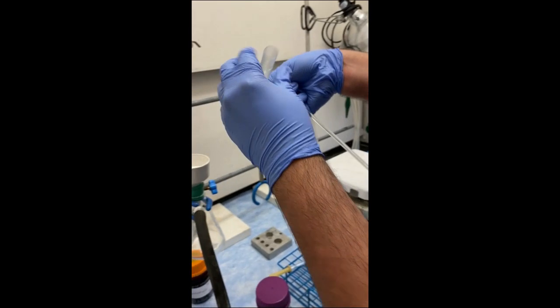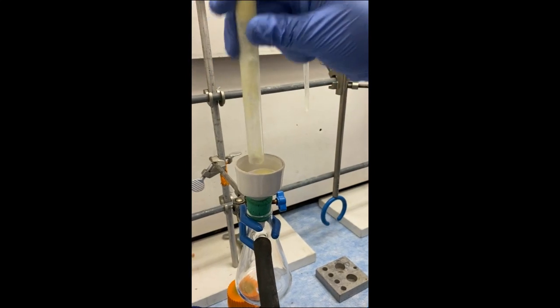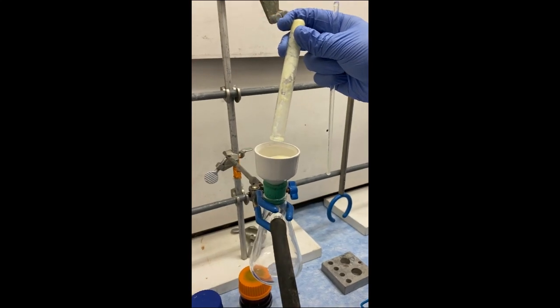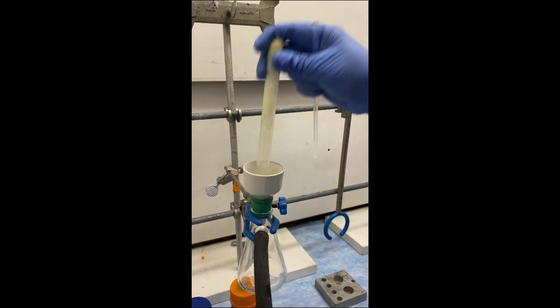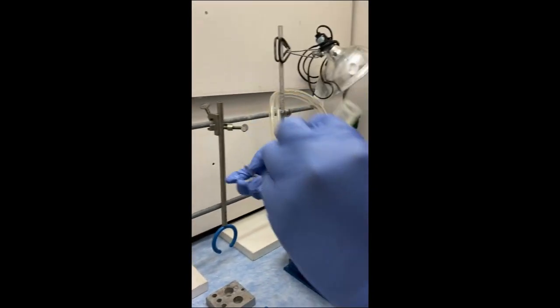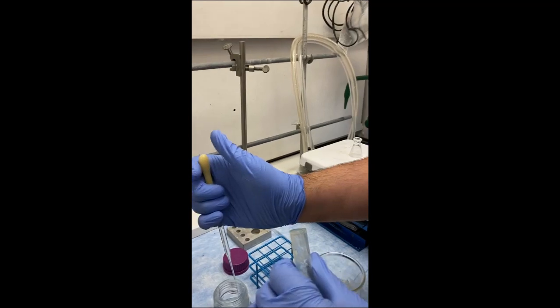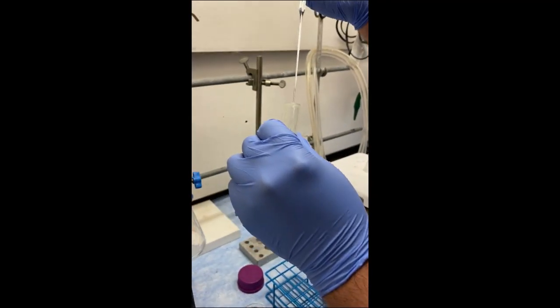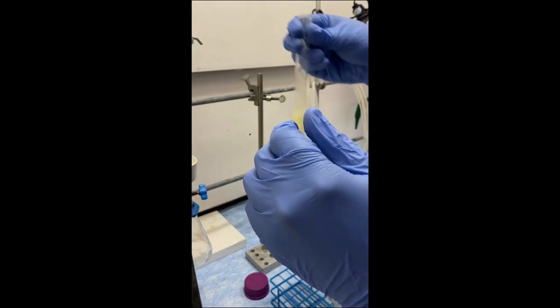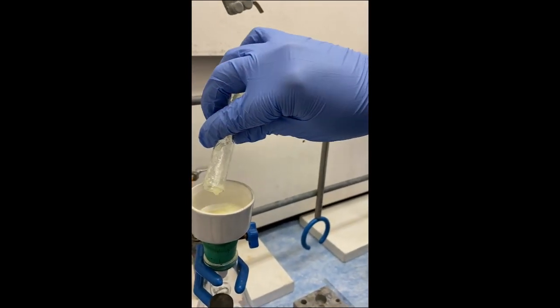Now removing the crystallized reaction crude mixture — and I stress crude — because right now we have leftover benzaldehyde and acetophenone in the crystals, which is why we need to do a recrystallization. If we were doing a melting point right now, it would not be sharp at all; it would be incredibly depressed and incredibly broad. You can still smell leftover benzaldehyde. He's going to add just a little bit more ethanol to rinse it out, being careful not to add too much because even though our product is mostly insoluble in ethanol, it has a slight solubility, and a lot of students lose product by adding too much solvent.